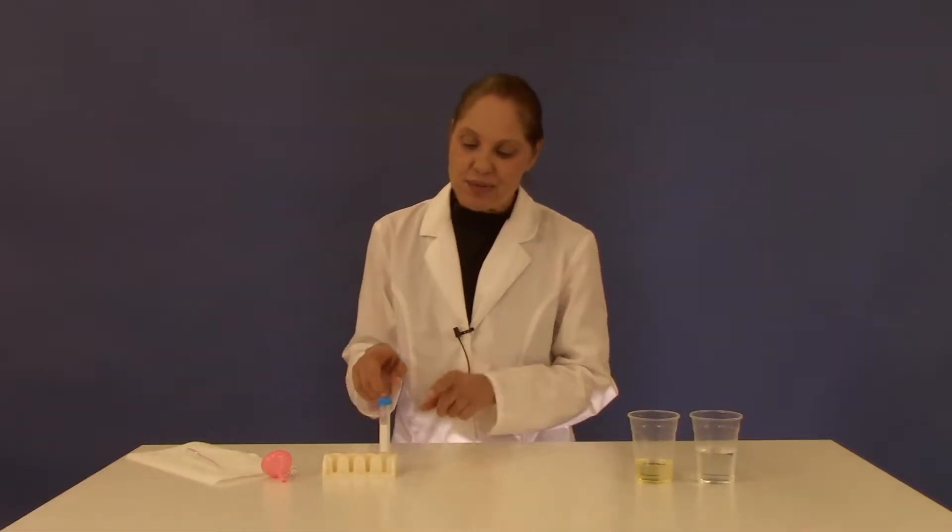From your kit, you're going to need one of the small test tubes, the funnel, and a pipette.